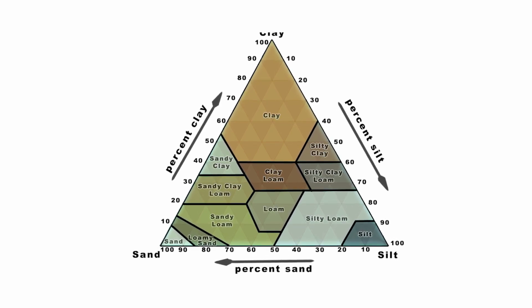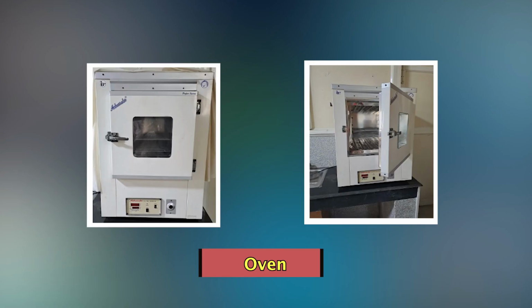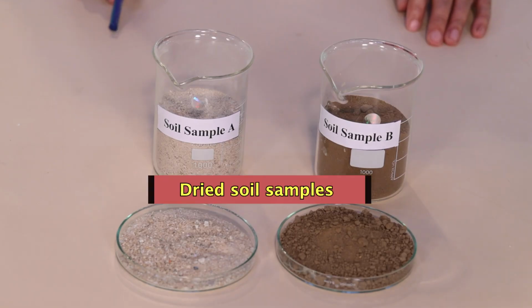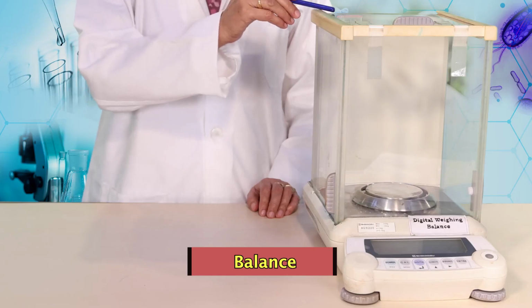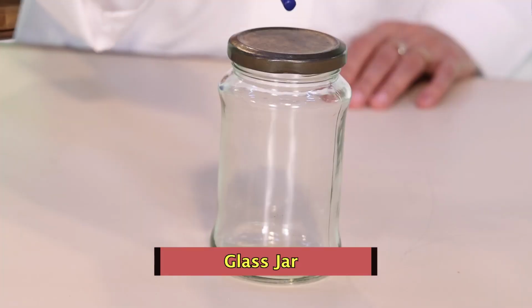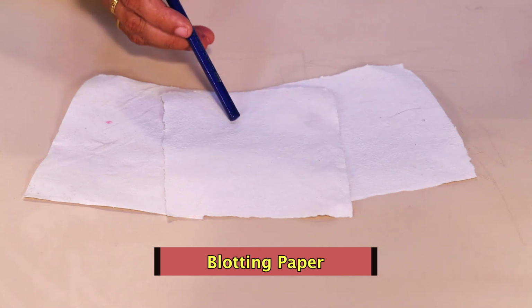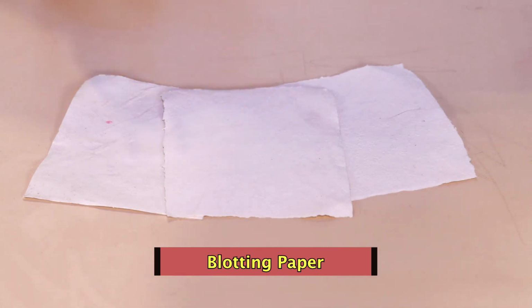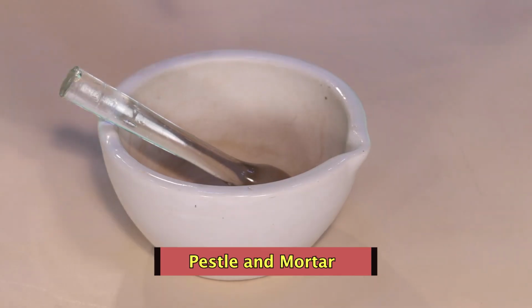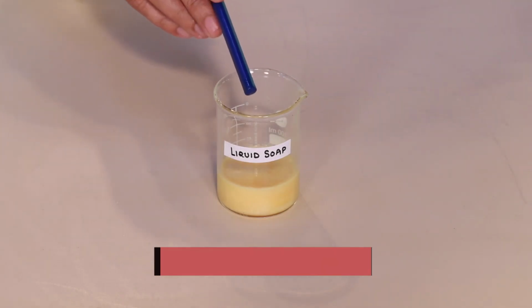To perform this experiment, we require oven, dried soil samples, balance, mechanical sieve set, glass jar or wide mouth bottle, scale, blotting paper or newspaper, pestle and mortar, borax or liquid detergent powder.